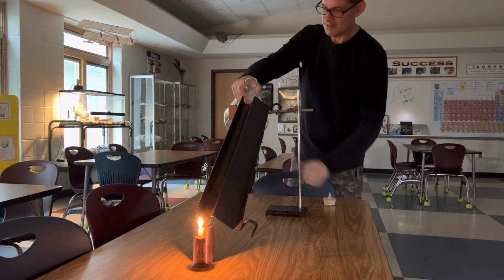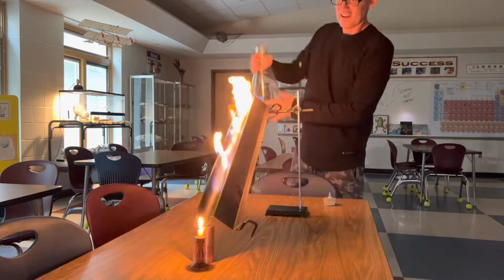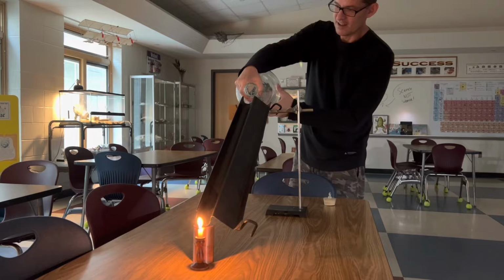I'll pour a little bit of gas down the slide. And it comes back up. Isn't that amazing?